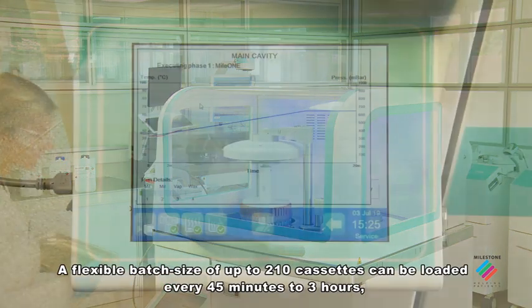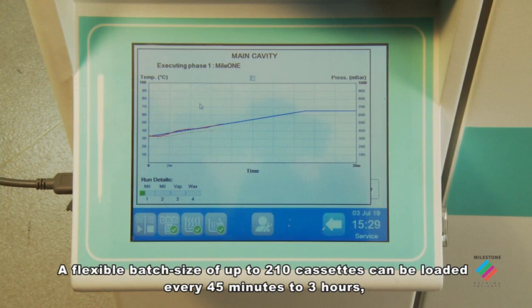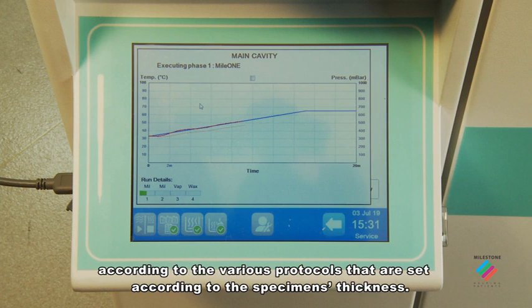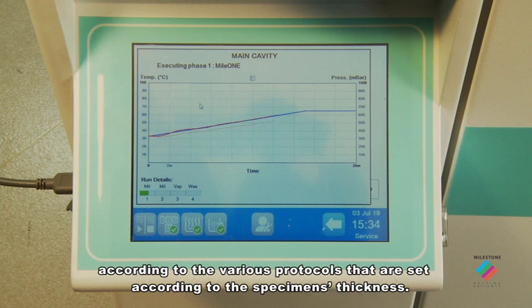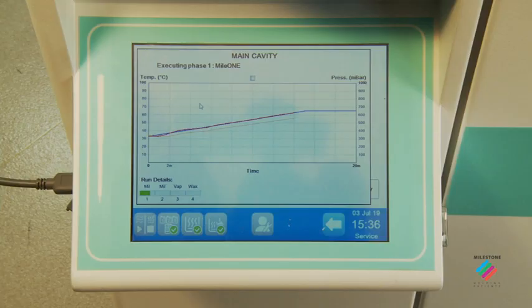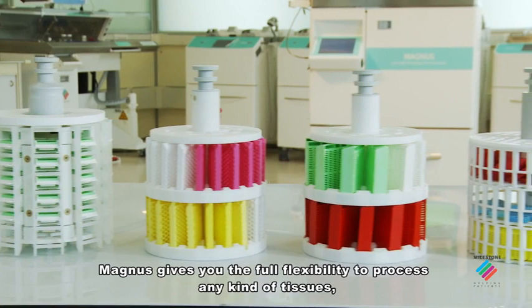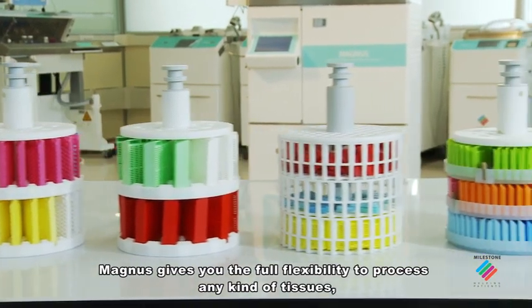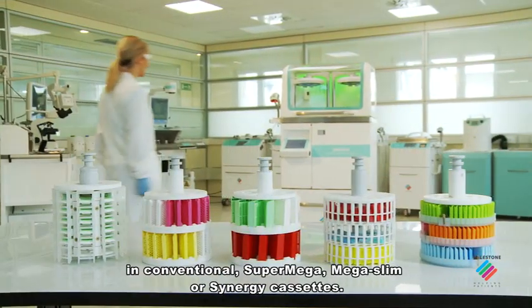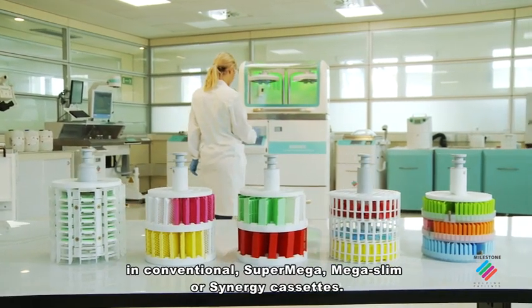A flexible batch size of up to 210 cassettes can be loaded every 45 minutes to 3 hours, according to the various protocols that are set according to the specimen's thickness. Magnus gives you the full flexibility to process any kind of tissue in conventional, super mega, mega slim or synergy cassettes.